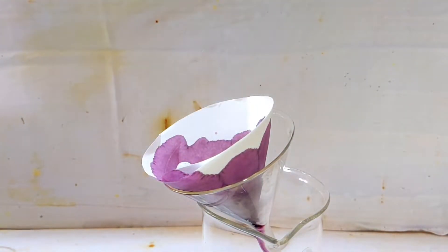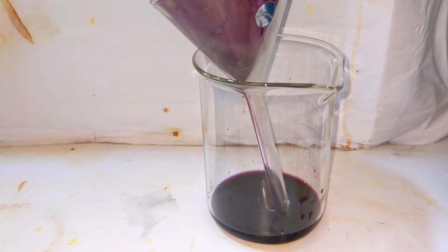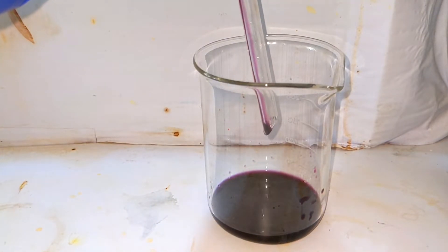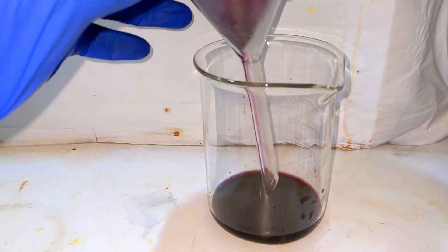So what I decided to do is to reduce the volume by about half of the present volume by heating the solution and then evaporating the solution to see what we get.